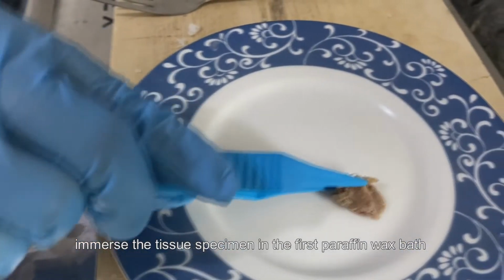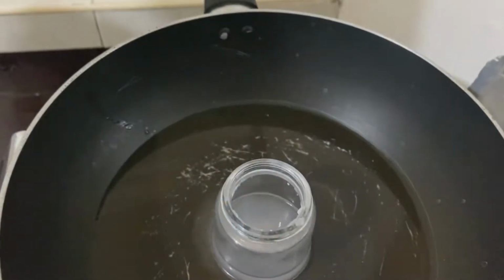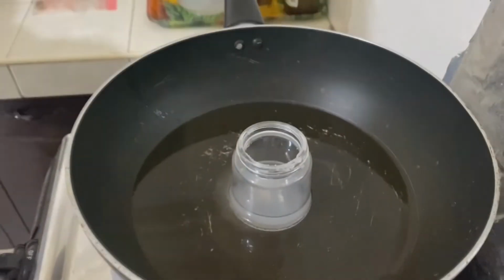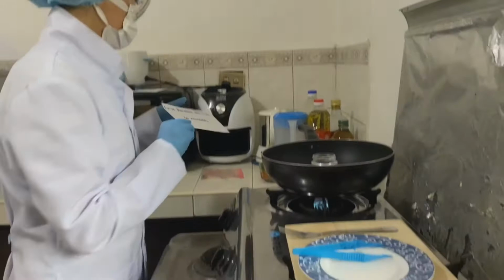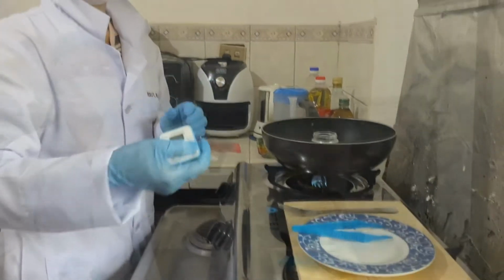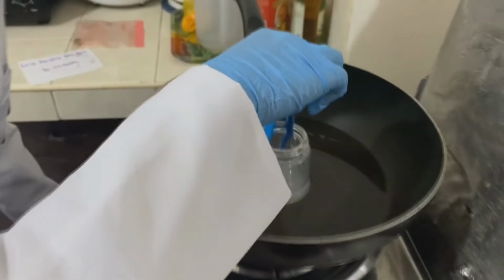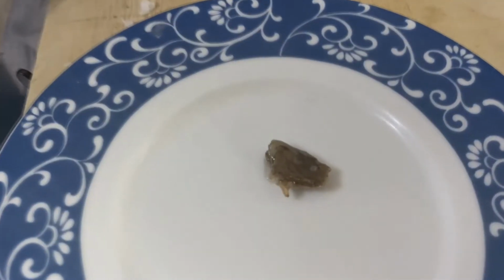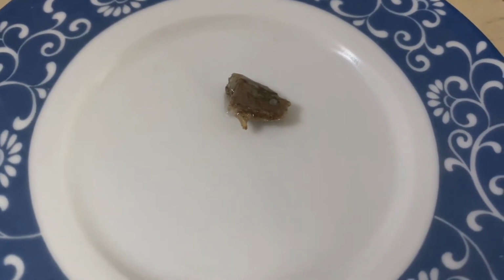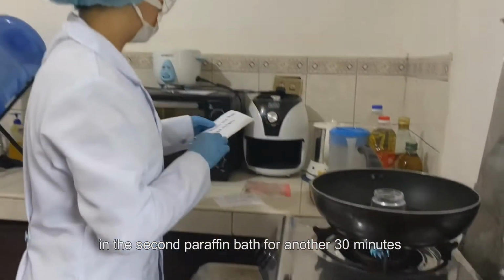Immerse the tissue specimen in the first paraffin wax bath for 30 minutes. After that, we will place the tissue specimen in the second paraffin bath for another 30 minutes.